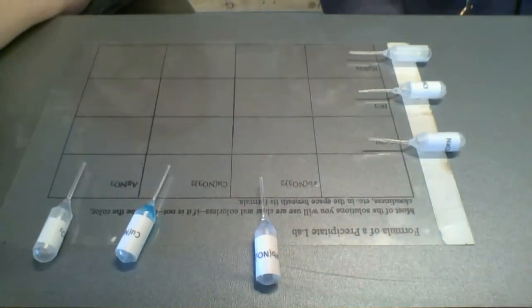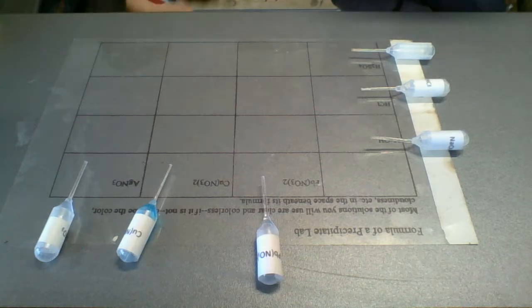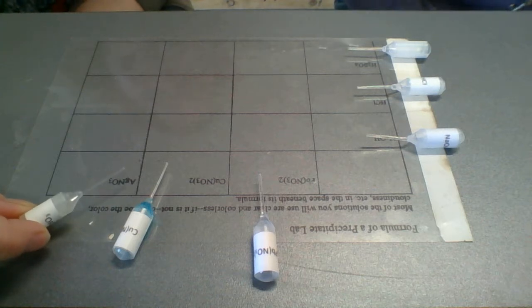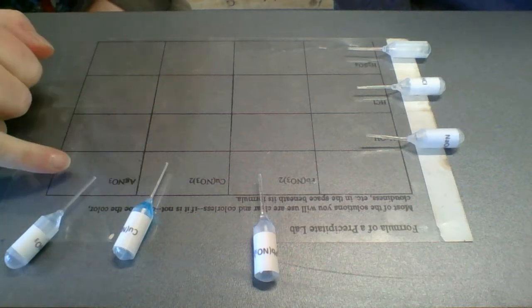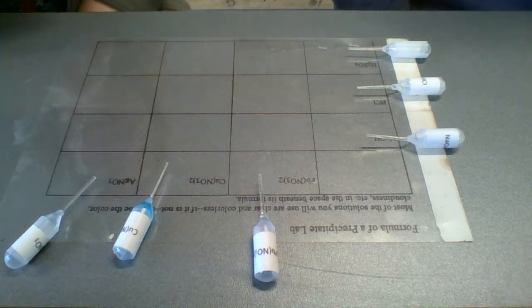So we're gonna tip, so you won't see us. Ooh, and I think you can see it there. Woohoo! It looks like you can see. All right, very good. So you might notice that there are these little tiny pipettes, and they've got some liquid in them. And each pipette is labeled with a different solution. So this one that I was just picking up is silver nitrate.